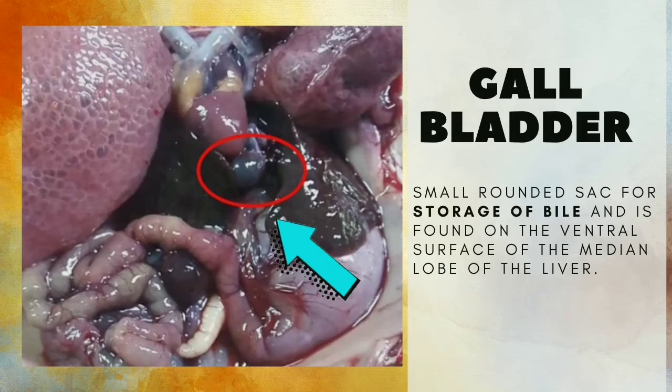The gallbladder is a small rounded sac for the storage of bile and is found on the ventral surface of the median lobe of the liver.